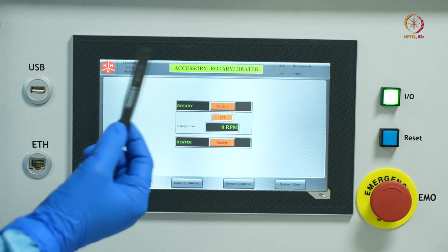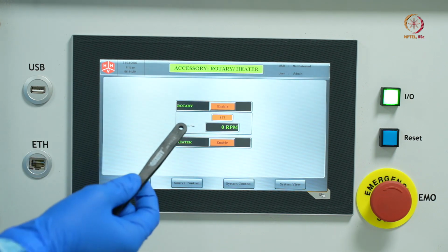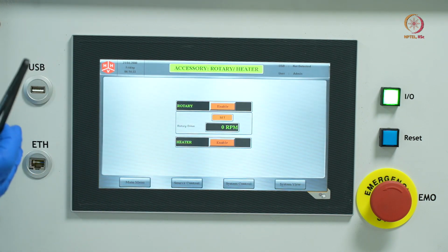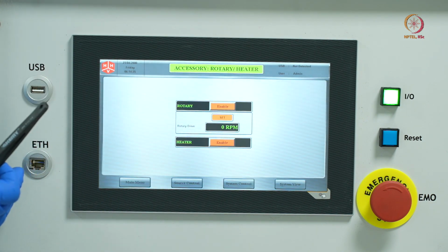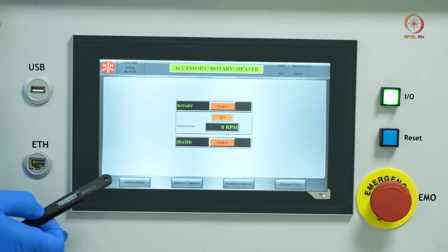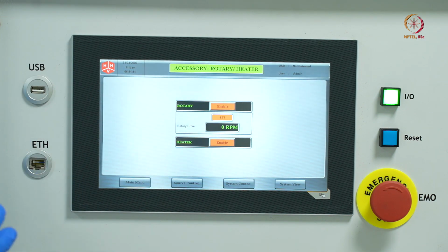Like I said, in that ETM it was showing that the current temperature is 27, and we can set it, and it was set to 300. We can choose any value from between the room temperature to a maximum of 300 and enable the heater. So it will take some time, and finally you will reach the desired processing temperature.